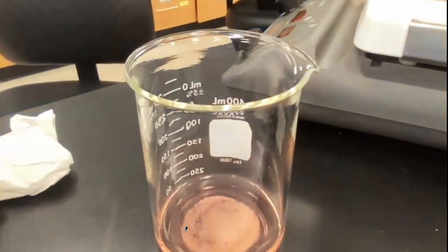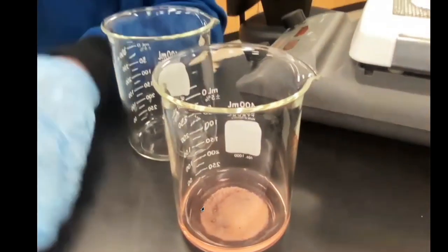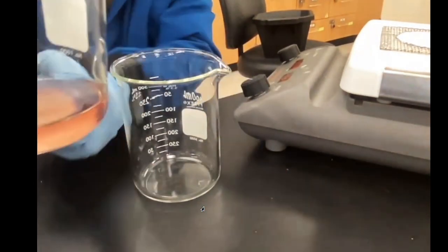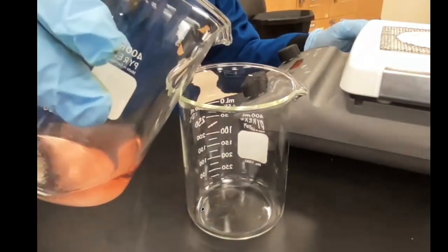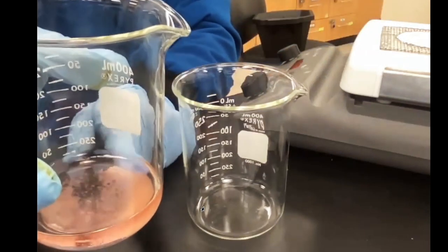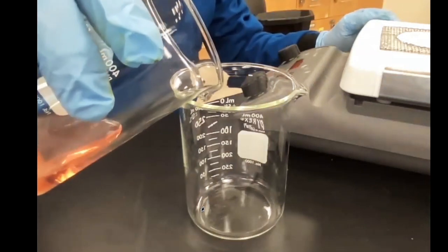Let me get a beaker. So here's an empty beaker, and notice what I do. Okay, I'm going to take this, and the more dense material is going to stay in the bottom, but the water, which is less dense, and you guys know that the material that's more dense than water is going to sink, and then water is allowed to flow through.